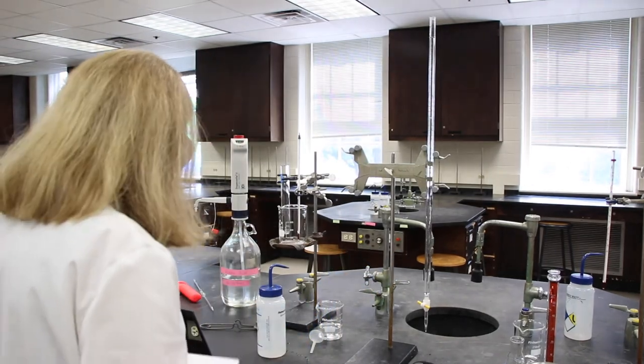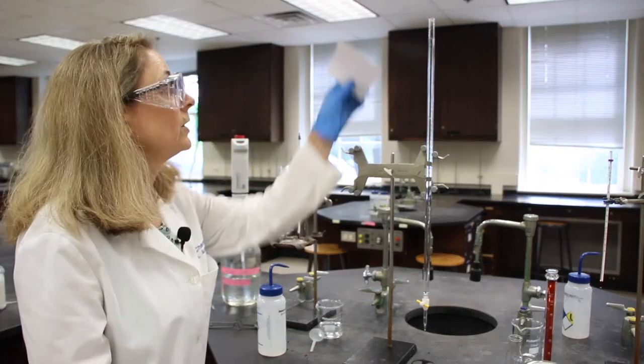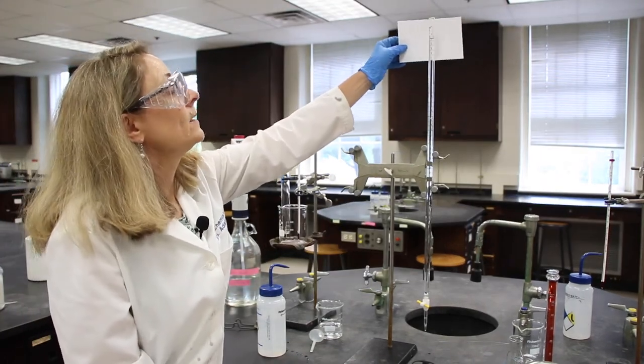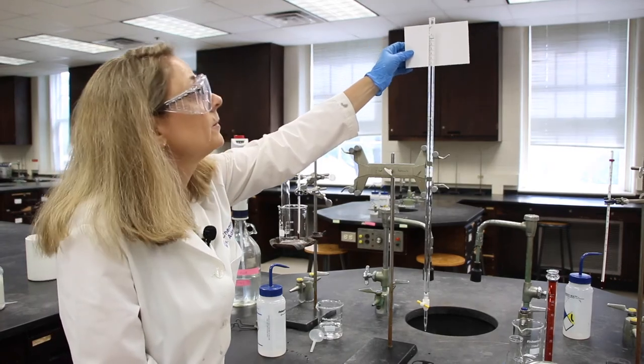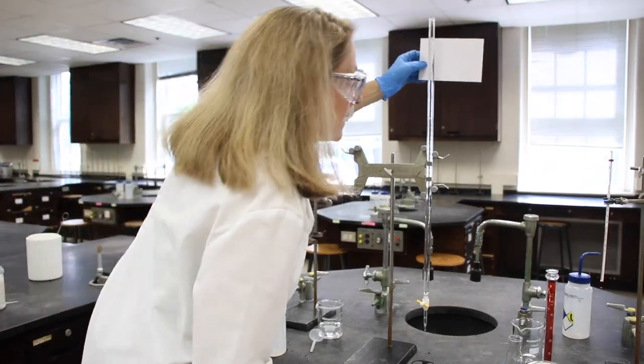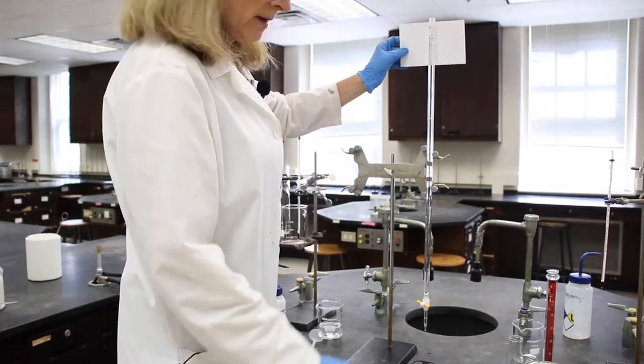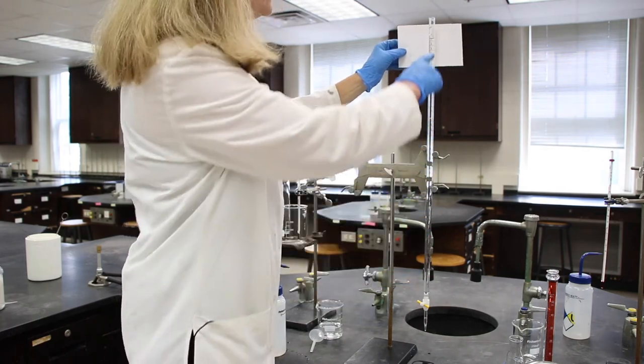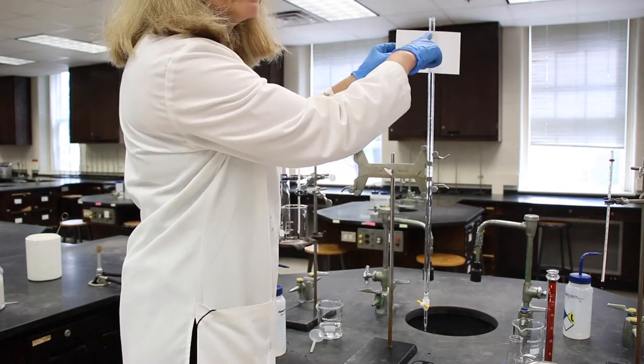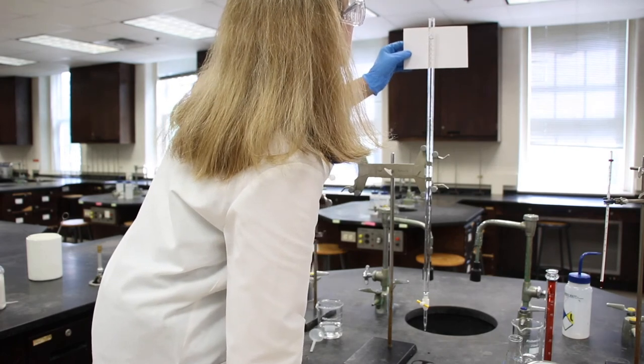Again, it's very helpful if you put a piece of white paper behind the burette. The readings tend to pop out, and if you're a little shorter like I am, feel free to stand on the stool. You'll want to read at the bottom of the meniscus.